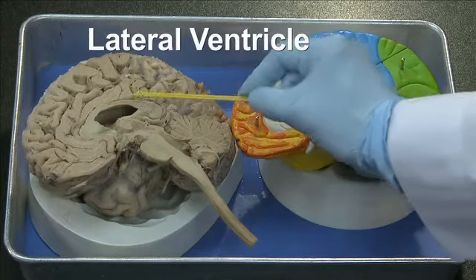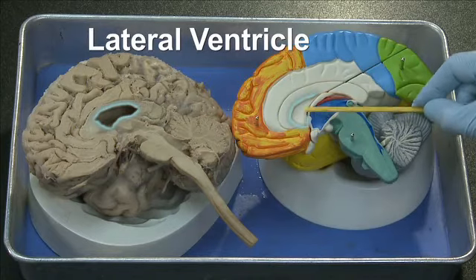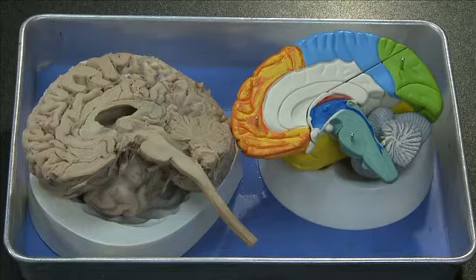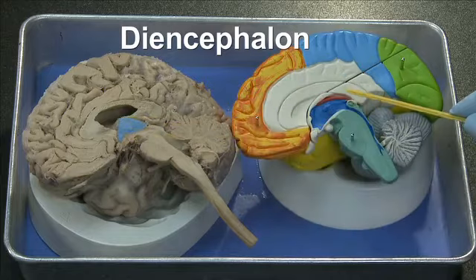Then we have here the lateral ventricle, a space in the brain. And the next structure we can observe here is the diencephalon. And in the model we can see that in blue.